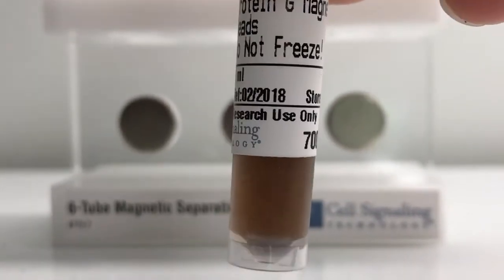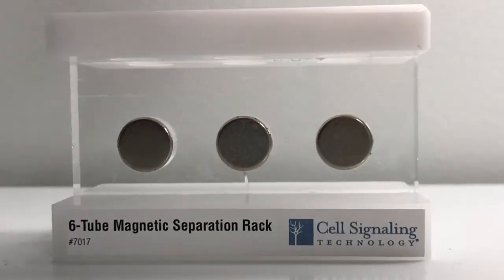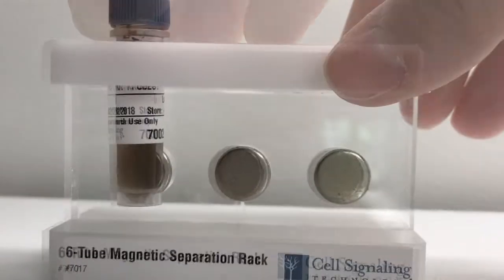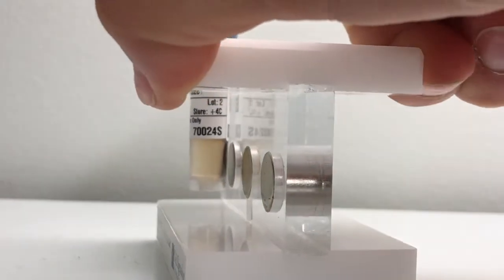Magnetic beads have gained in popularity, and magnetic separation affords a faster protocol without the need for centrifugation. But whichever format you choose, it's always a good idea to incorporate proper controls.